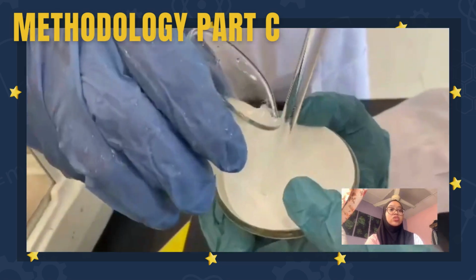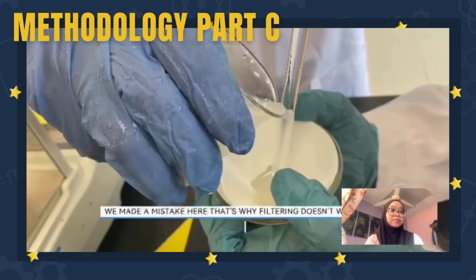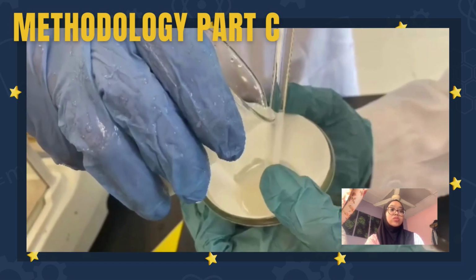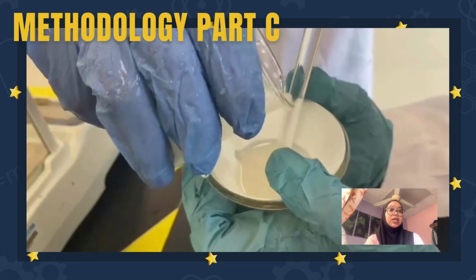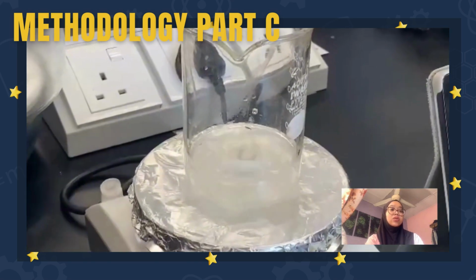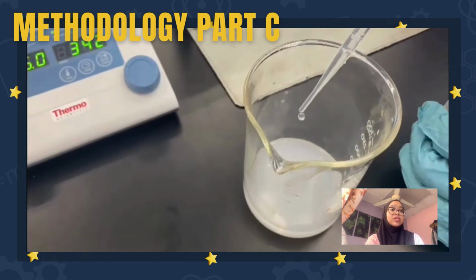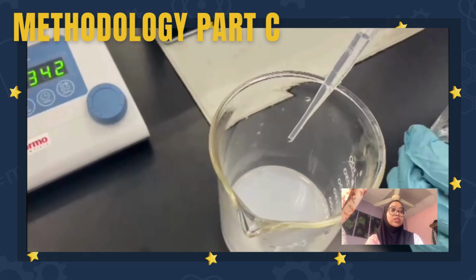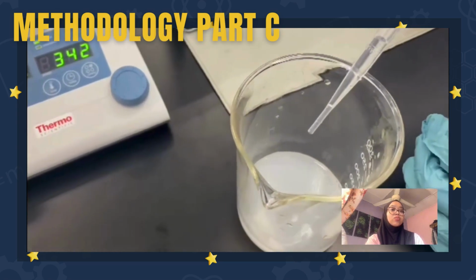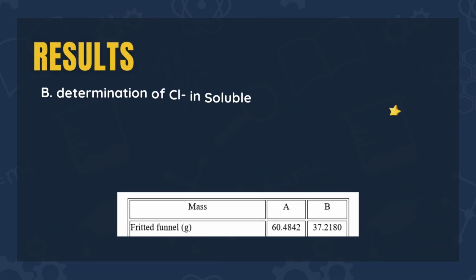The solid residue of flour was removed and filtered using filter paper. The solution was heated gently on a hot plate to about 60 to 70 degrees. Then silver nitrate was slowly added dropwise while stirring. A white precipitate of silver chloride formed immediately.